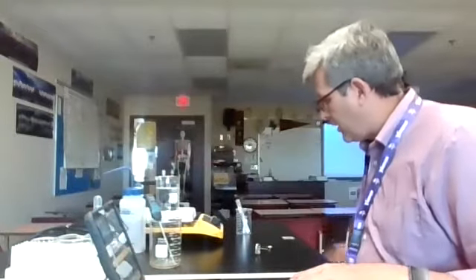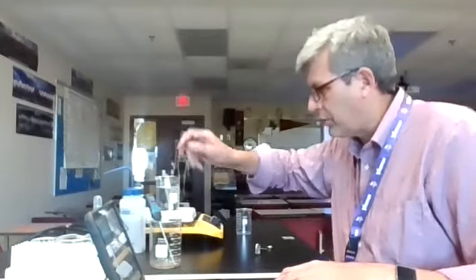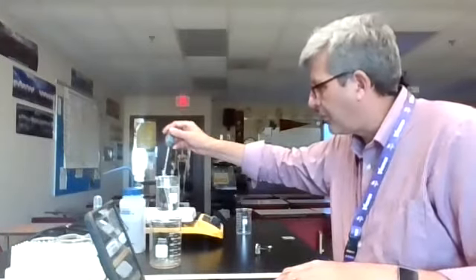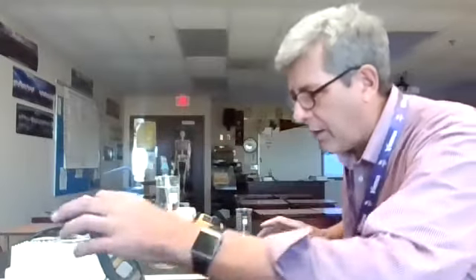The water is starting to heat up. So what I'm going to do is go ahead and put my paradichlorobenzene in there, put the thermometer in there. It's not going to sink in there yet because that stuff's pretty hard, but I'm going to start collecting my data. And you can see the data is collecting across there as we go.